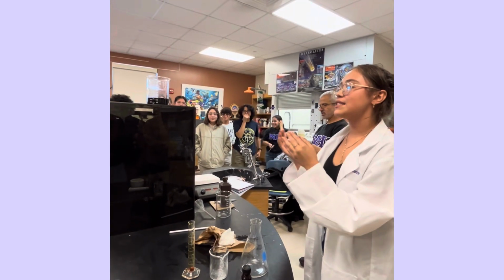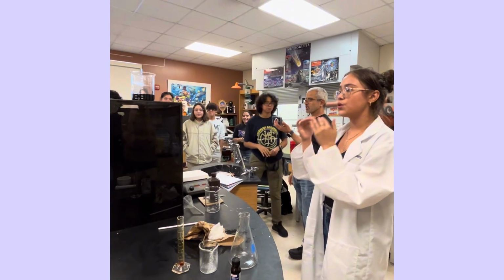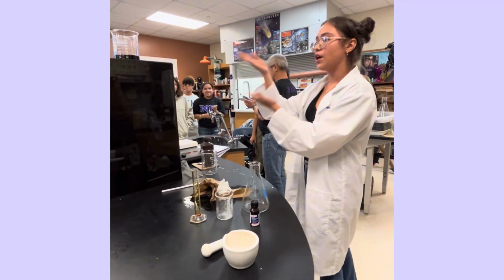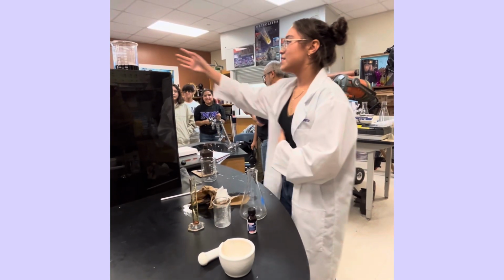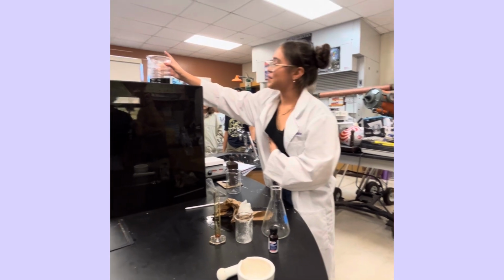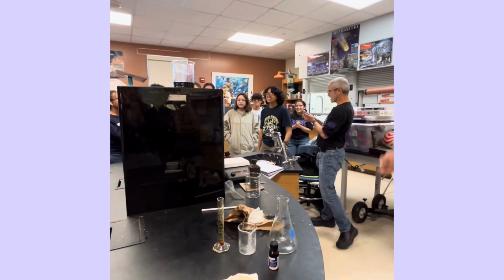It happened because the vitamin C gets used up. So now we have the iodine that reacts with the starch and makes it the original color, blue, which is the color iodine is. So now you guys can see the colored solution, which is very dark, almost black. So let's explain it.